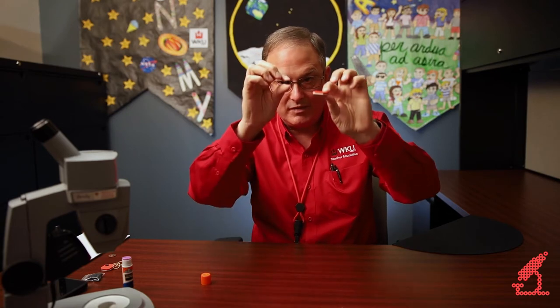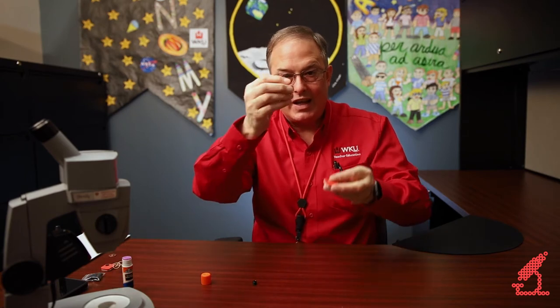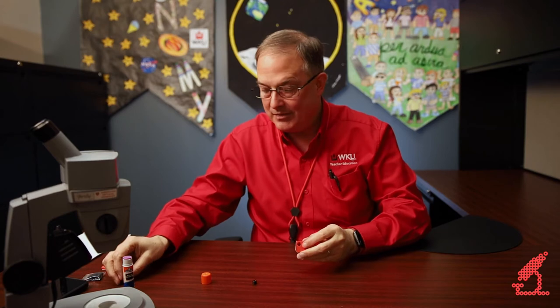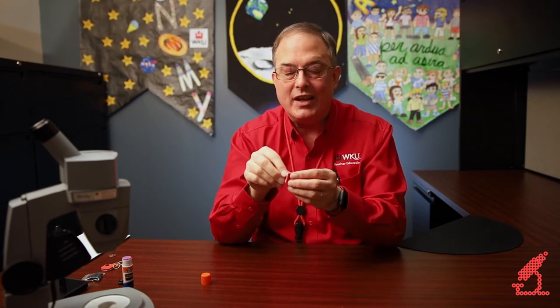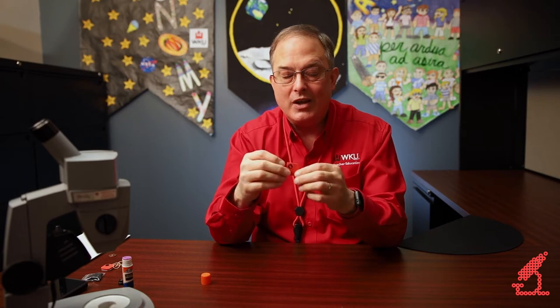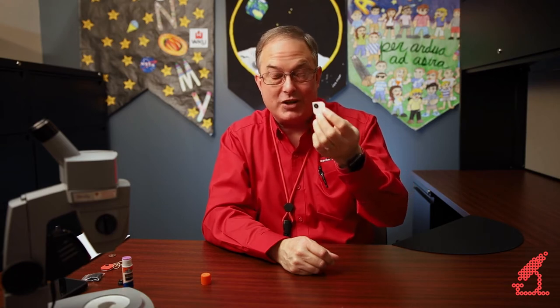I'm making this stack as thick as this lens is tall. If I had a different lens, I would stack more of them, and my hole would be cut to that size. Now all I have to do is take the lens — and these lenses are symmetrical, so there's no wrong way to slide it in — and all you do is slide it in, and you have made a microscope. Your total investment is just a tad over a dollar.